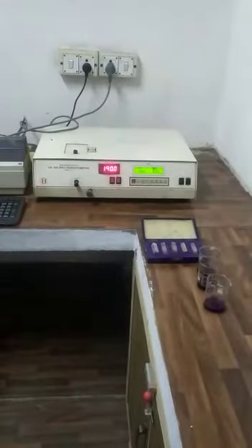This is an experiment that is based on colorimetry. Colorimetry is based on light UV and infrared radiation. The visible spectrum from violet to red is 400 to 750 nanometers, so the maximum range is at 750. Below 400 is ultraviolet. We have to set the instrument first at 750.